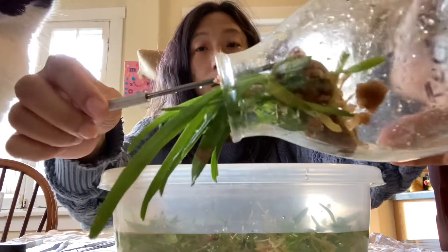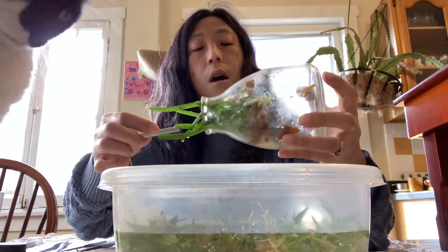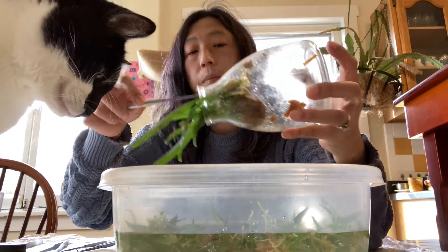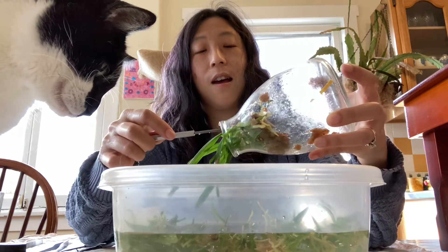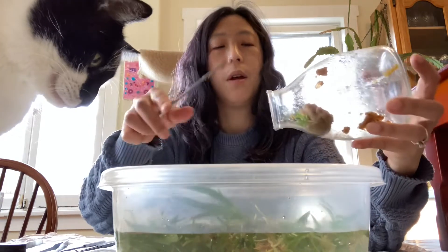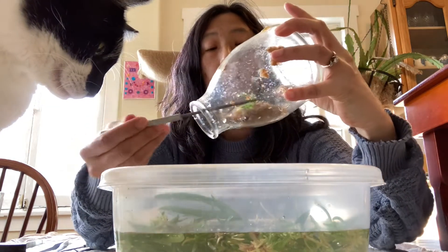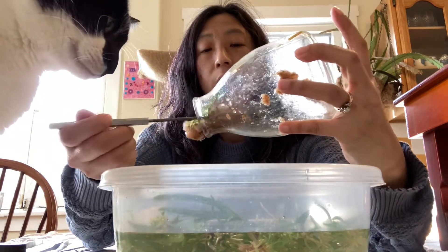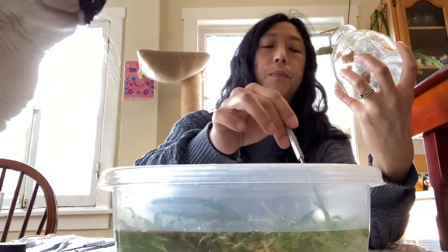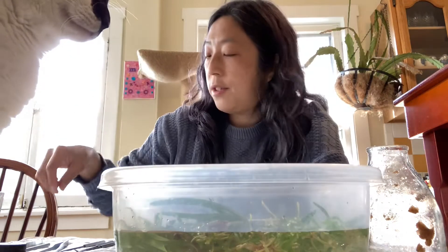This one is not coming out — it's really big and it's kind of stuck in the mouth. Hand pull. There we go. One last little green guy right here. Come on. There we go. The flask is empty. Oh, that wasn't so bad. I think that was a great practice fishing expedition.